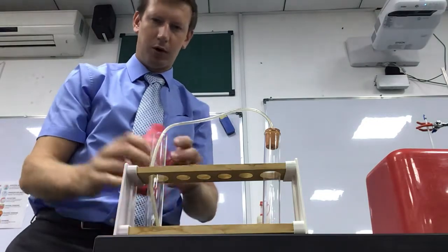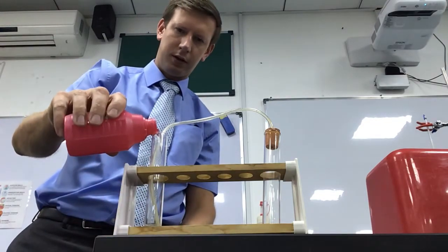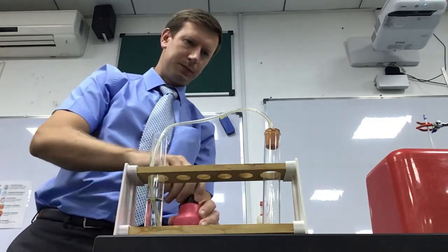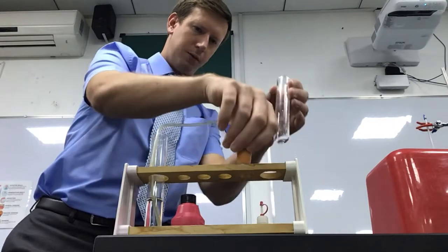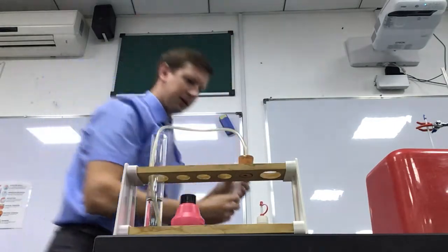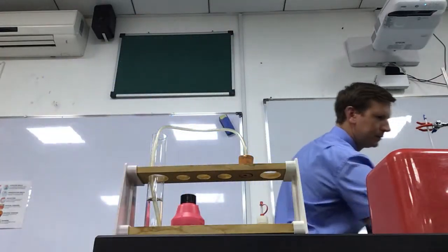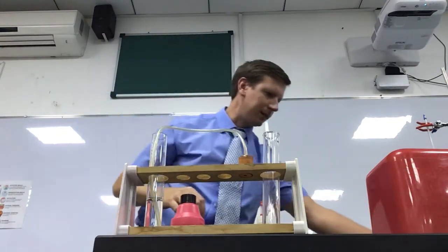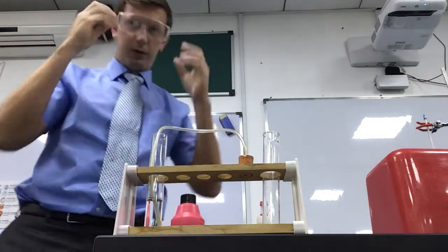I'm just going to pour some lime water into here so that the end of the tube is covered. I'm then going to pour some acid in. Because I'm about to touch acid, I'm going to put my goggles on for safety.